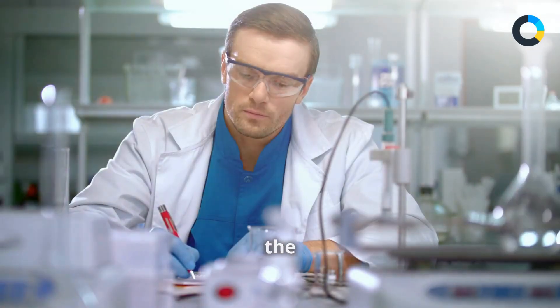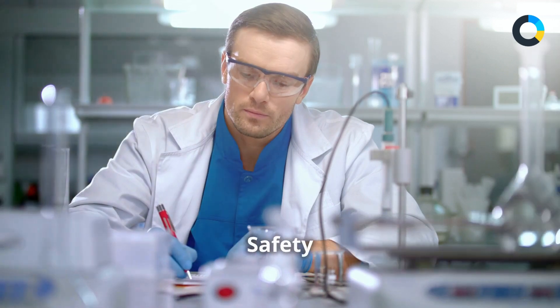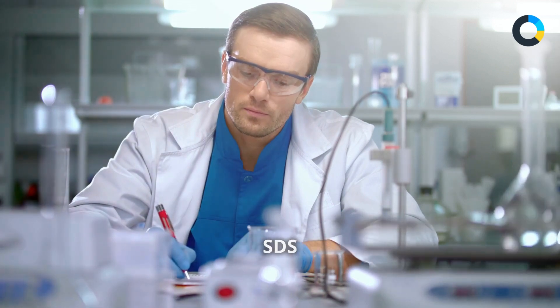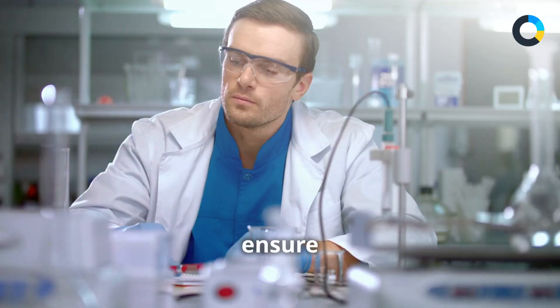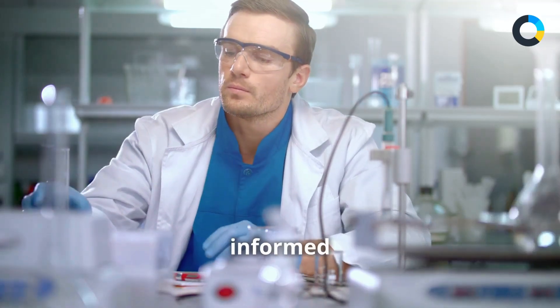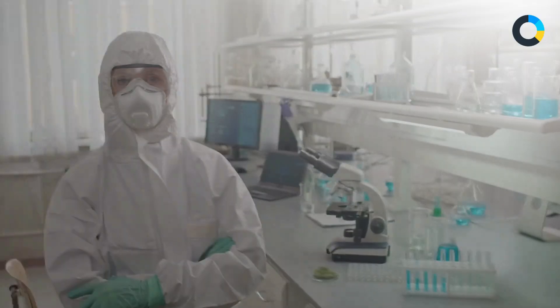We'll guide you through the importance of safety data sheets, SDS, and proper labeling to ensure you're always informed about the chemicals you work with.